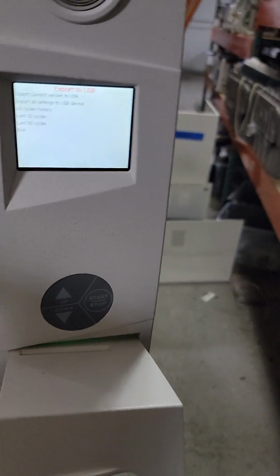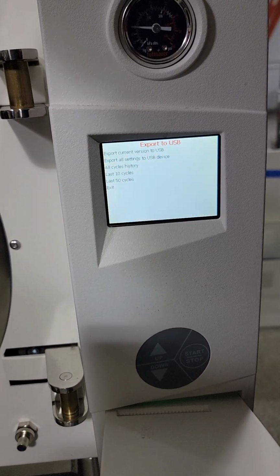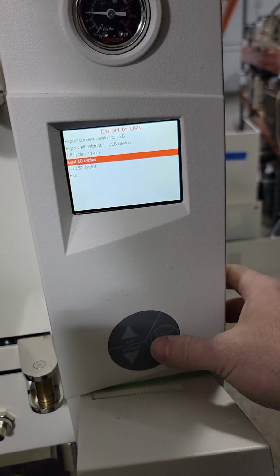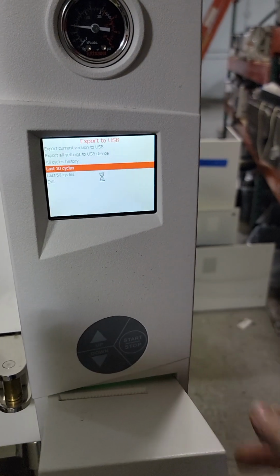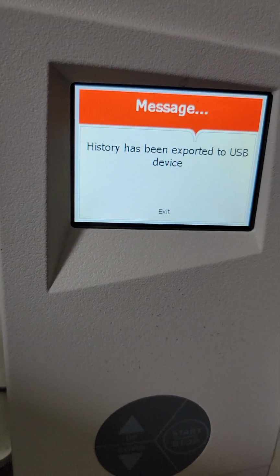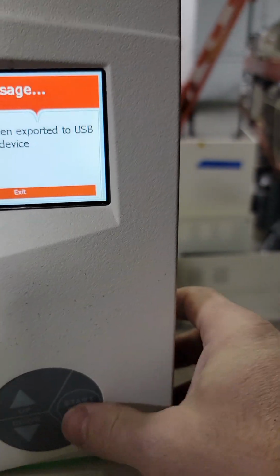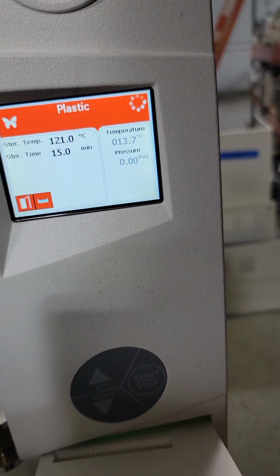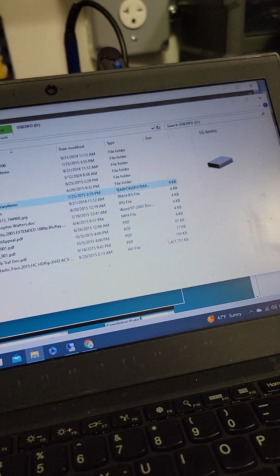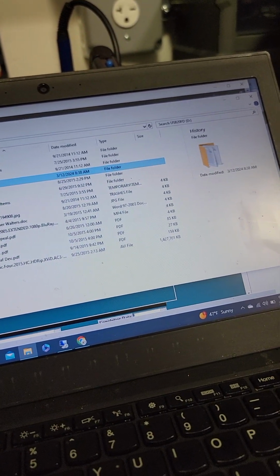Of course, I have tons of these things. They're really not the greatest for backups. You should back them up on something else. Anyway, last 10 cycles. There we go. Here's your USB device. Okay. They might want to see what that data looks like. Anyway, let's go. History.